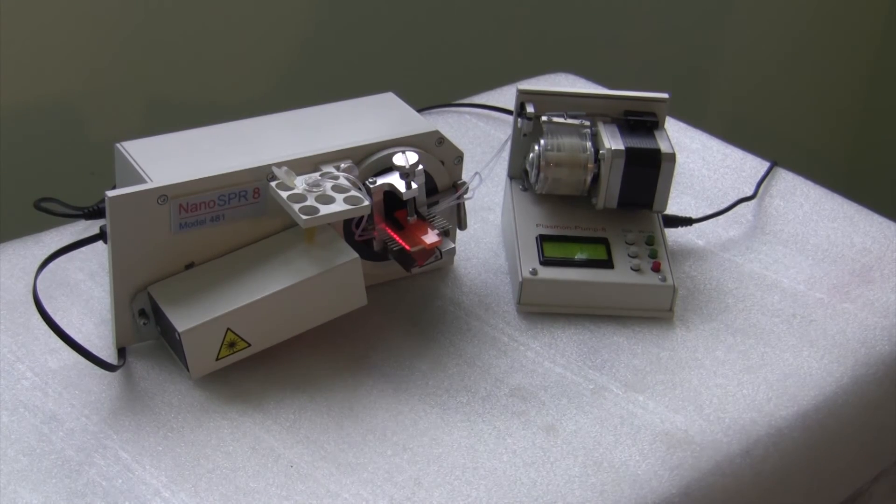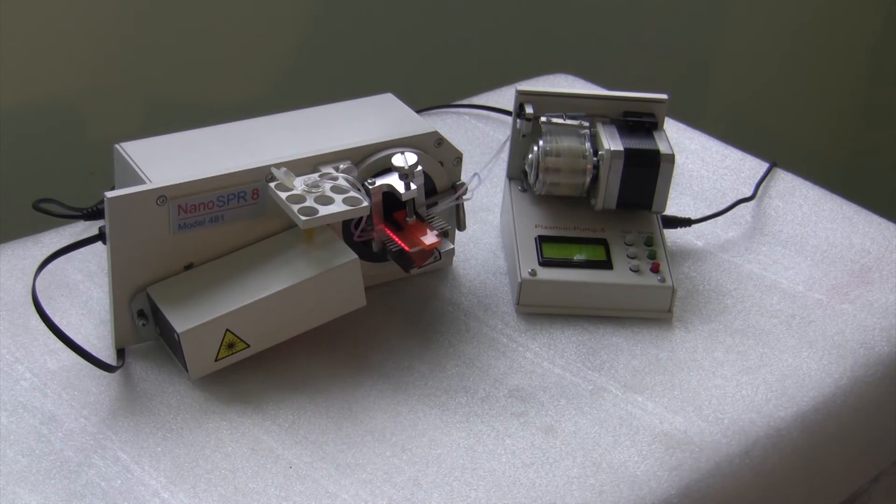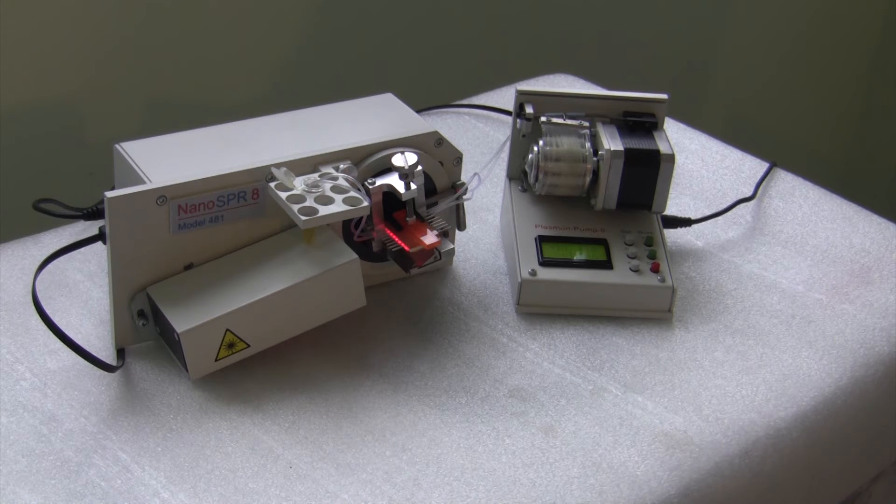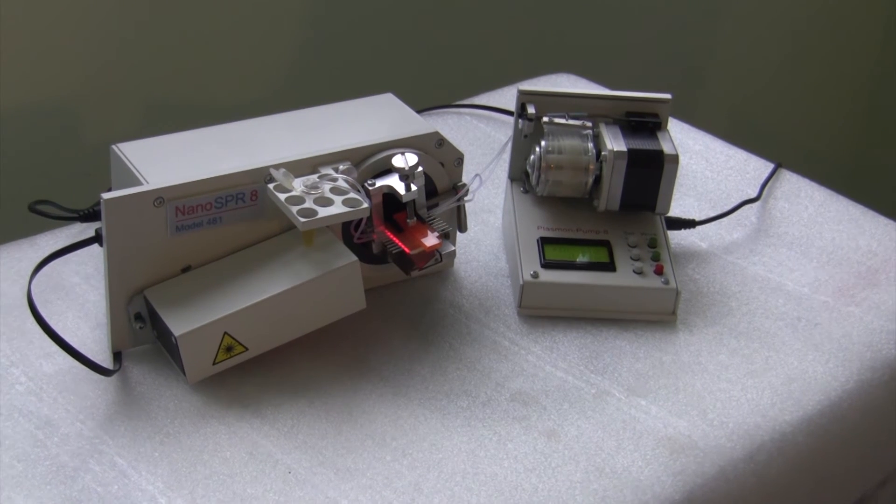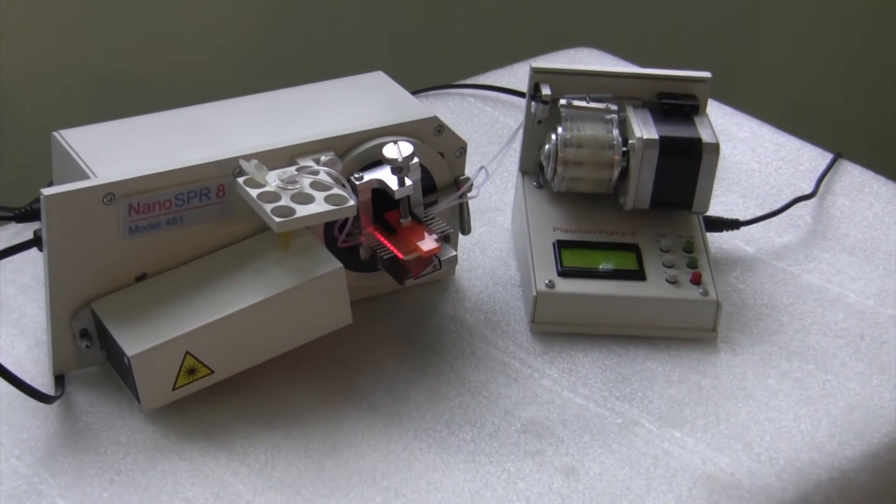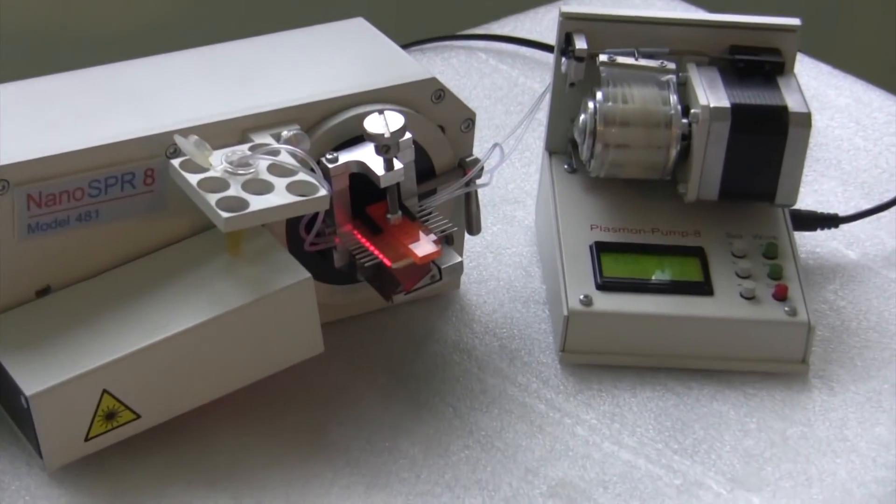In slope mode, we choose the point on a full curve and device continuously measures the response signal without mechanical movement. In this mode, we are able to gather many data points in a short period of time.